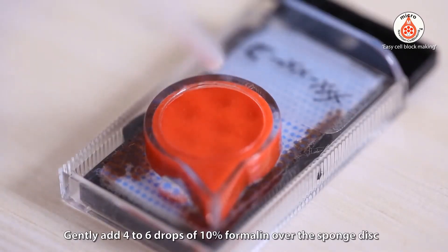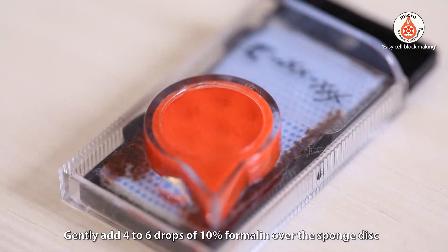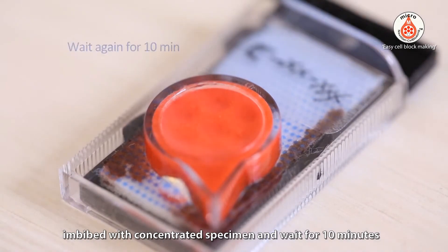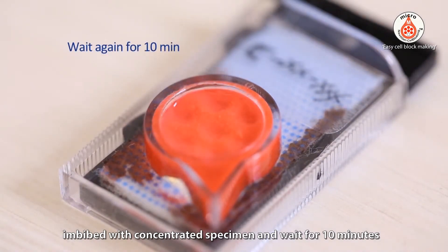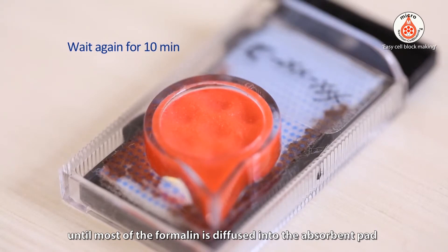Gently add 4 to 6 drops of 10% formalin over the sponge disk imbibed with concentrated specimen, and wait for 10 minutes until most of the formalin has diffused into the absorbent pad.